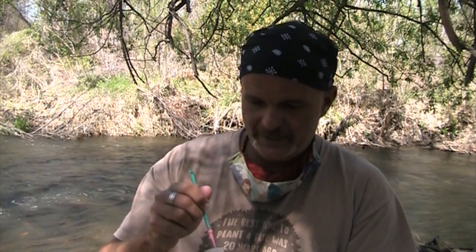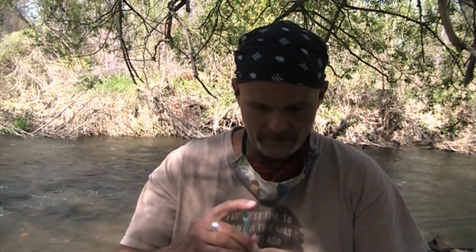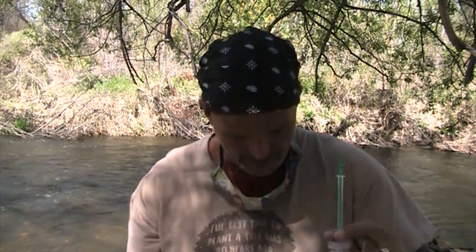Now, titration, I tell my students, is Latin for painfully slow. It's not. What you're going to do now is we're pretty close to the titration point. Your goal is to not make it clear. Your goal is to get a storm cloud or a Dementor in a bottle. So I'm going to add a few drops and swirl. Add a few drops, swirl.